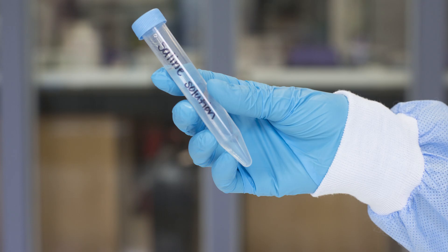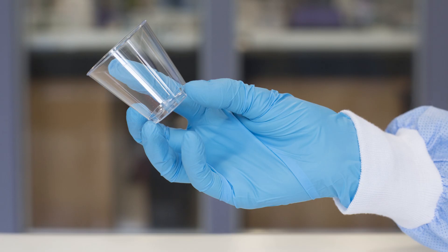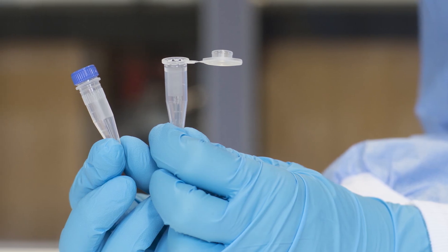saline solution for rinsing your mouth, a disposable plastic cup, and screw top and snap top microcentrifuge tubes.